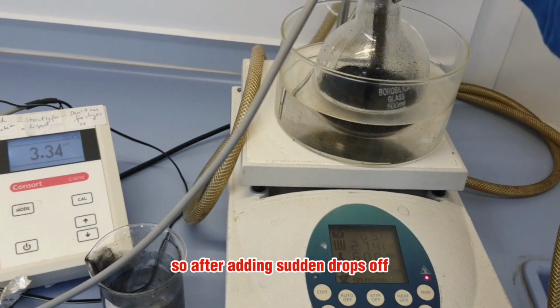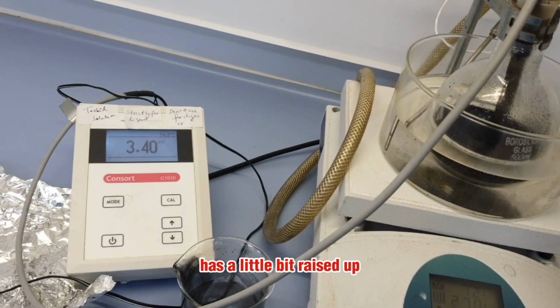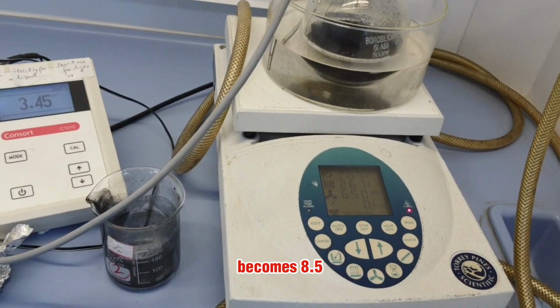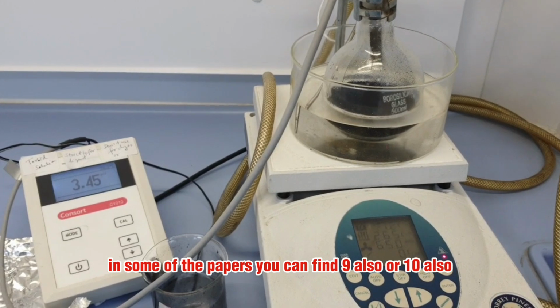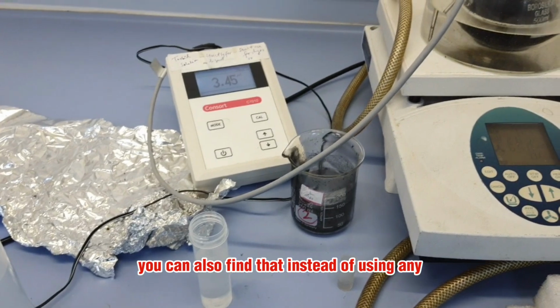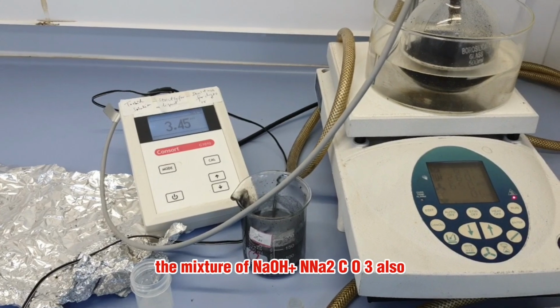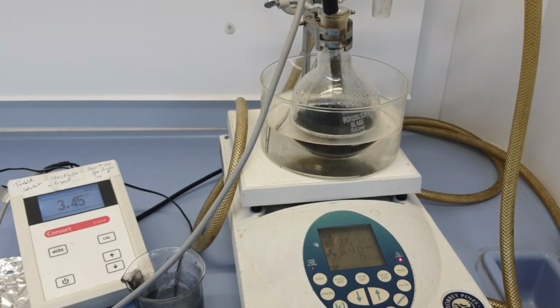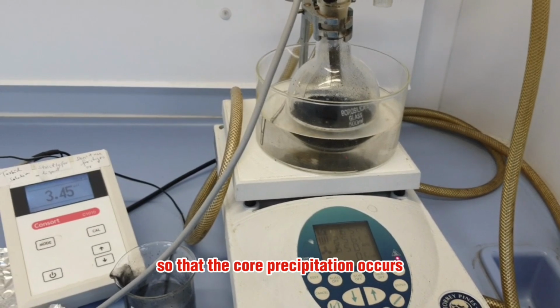After adding certain drops of NaOH, you can see the pH has raised up a little bit. We'll continue adding until the pH becomes 8.5 to 9. In some of the papers you can find 9 or 10 also, and in some of the literature you can find that instead of using NaOH, we can use a mixture of NaOH plus Na2CO3. Some papers also use ammonium hydroxide. Our main concern is to raise the pH so that the co-precipitation occurs.